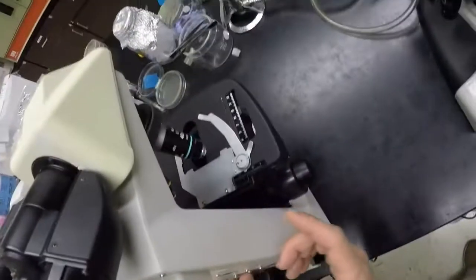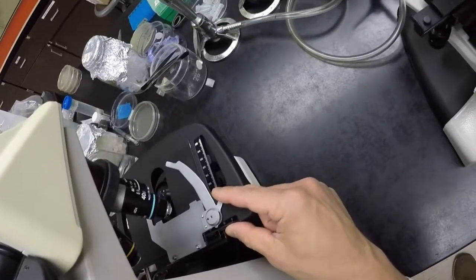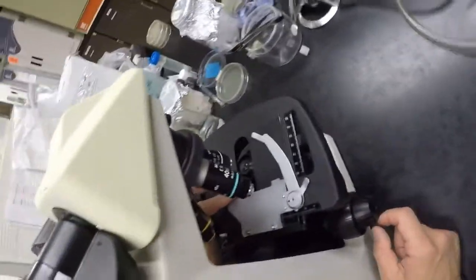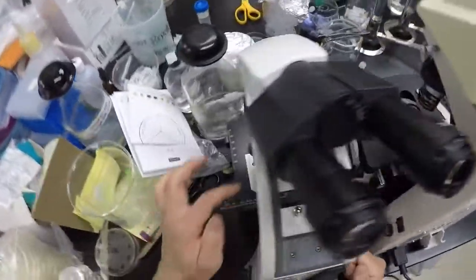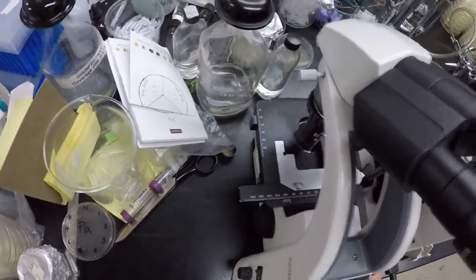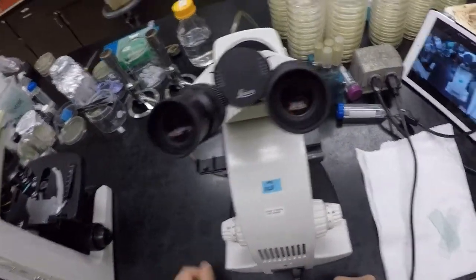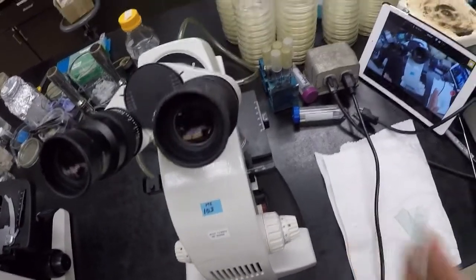Stage clips on the other two are a little bit different, right? So on the Nikon, the movable clip is on the right side. It's a claw, and then the corner is on the left over there. And then same with the Motic, the movable claw on the right, and the corner is on the left. But once they're in there, everything moves the same. So I'm going to try to move nice and slow. Good, so now we are in, our slide is loaded. Now we're ready to look.